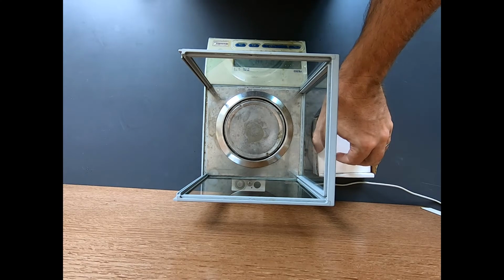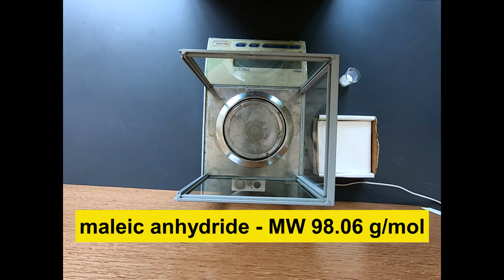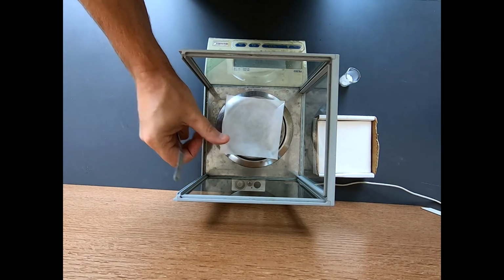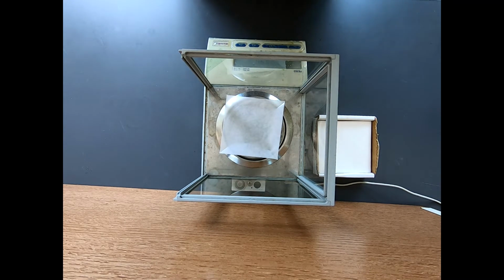Alright, so let's get started by weighing out our maleic anhydride, and I want just under probably 2 millimoles of this. So let's weigh this out, and that's right about 200 milligrams. Okay, so that's zeroed now. Let's see if we can get close but under 200 milligrams, like in the 190, 180 range.